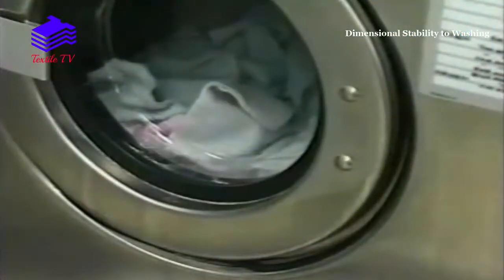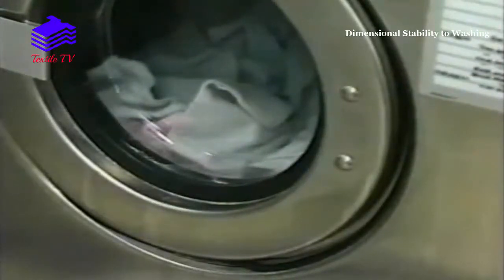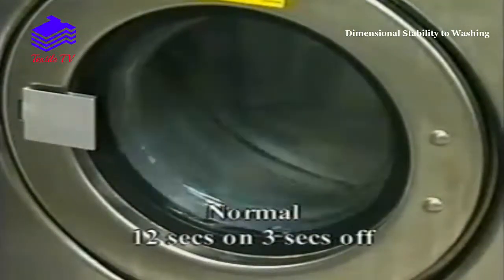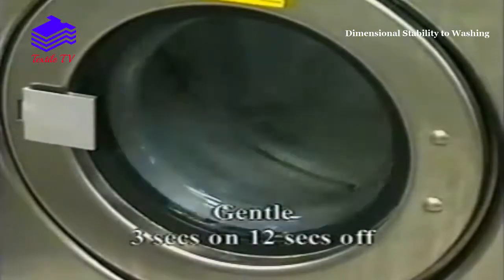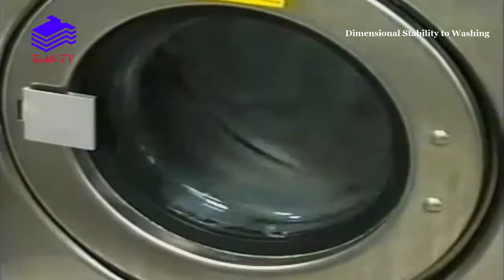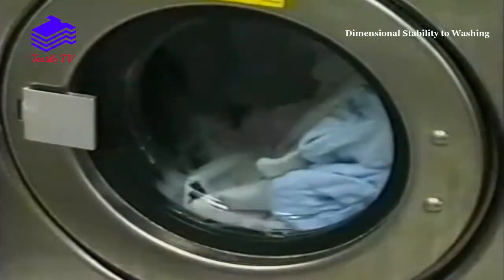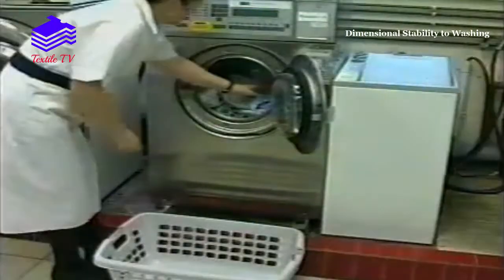The machine fills to the desired level and heats to the set temperature, then proceeds through the complete programme — either normal (12 seconds on and 3 seconds off) or gentle (3 seconds on and 12 seconds off). A buzzer sounds at the end of the completed programme.